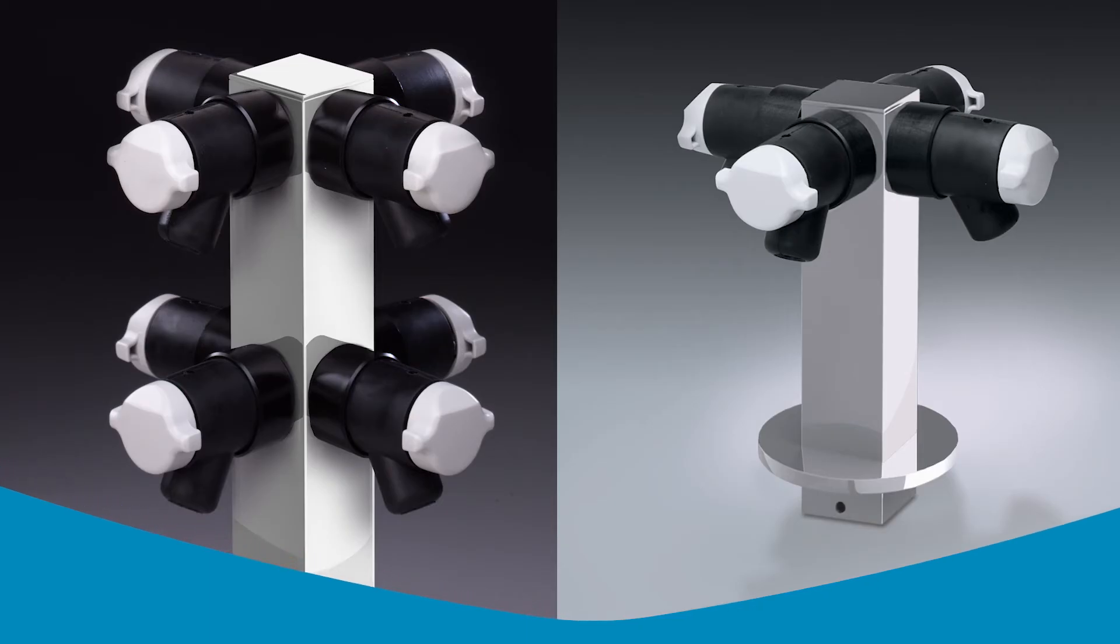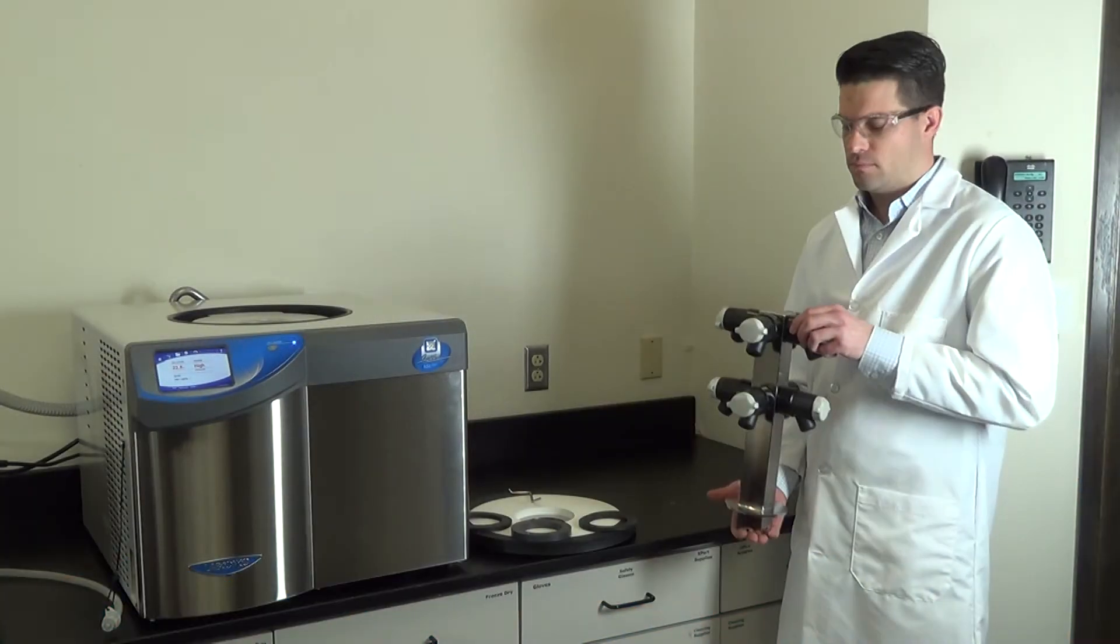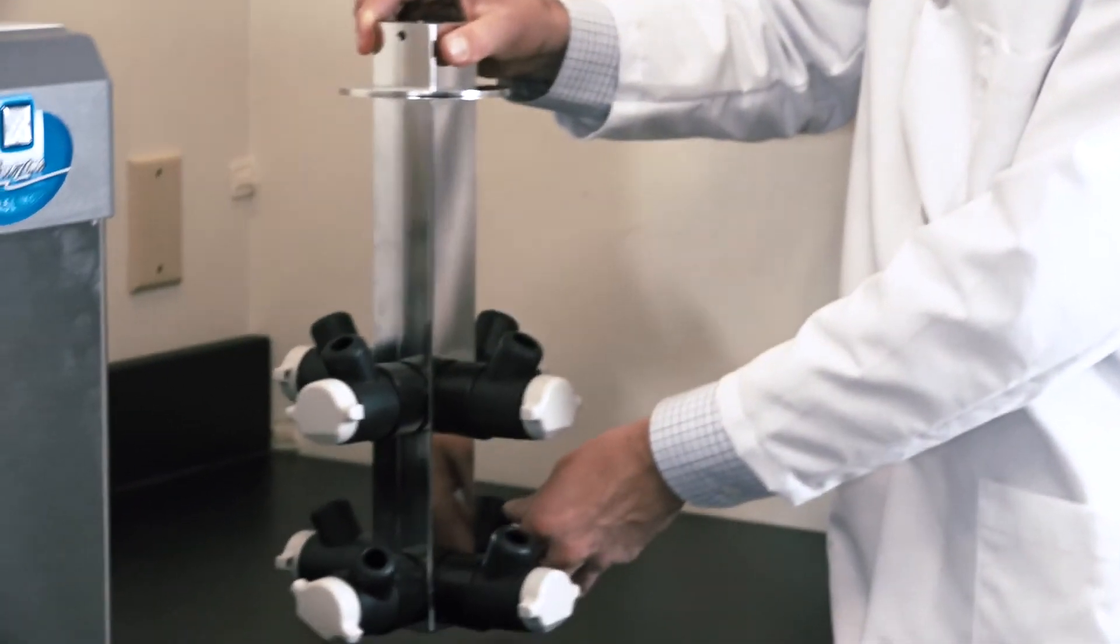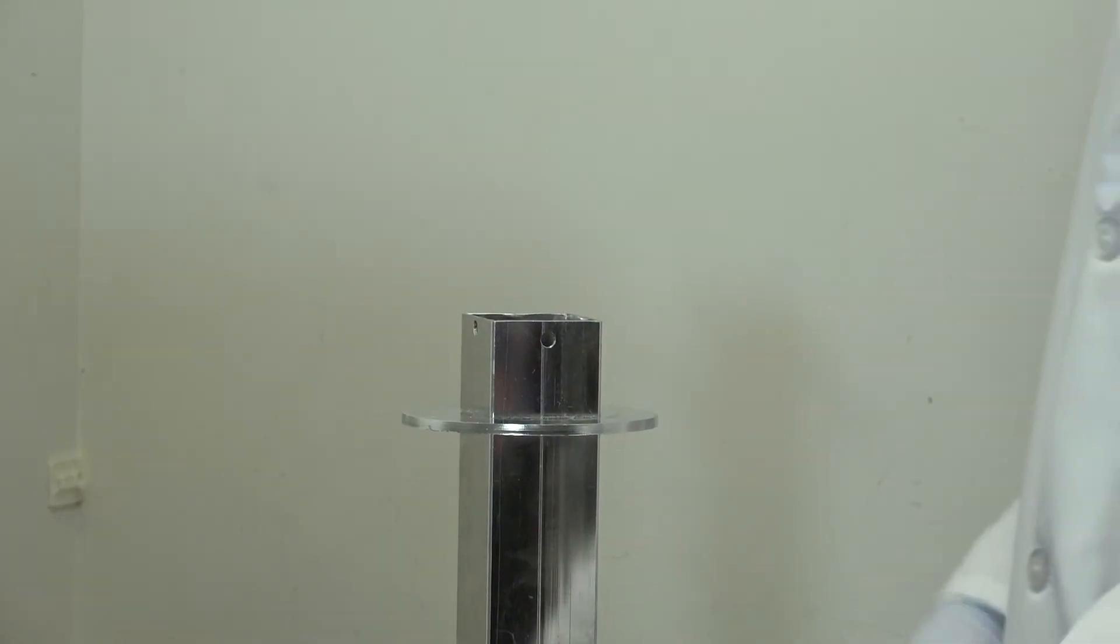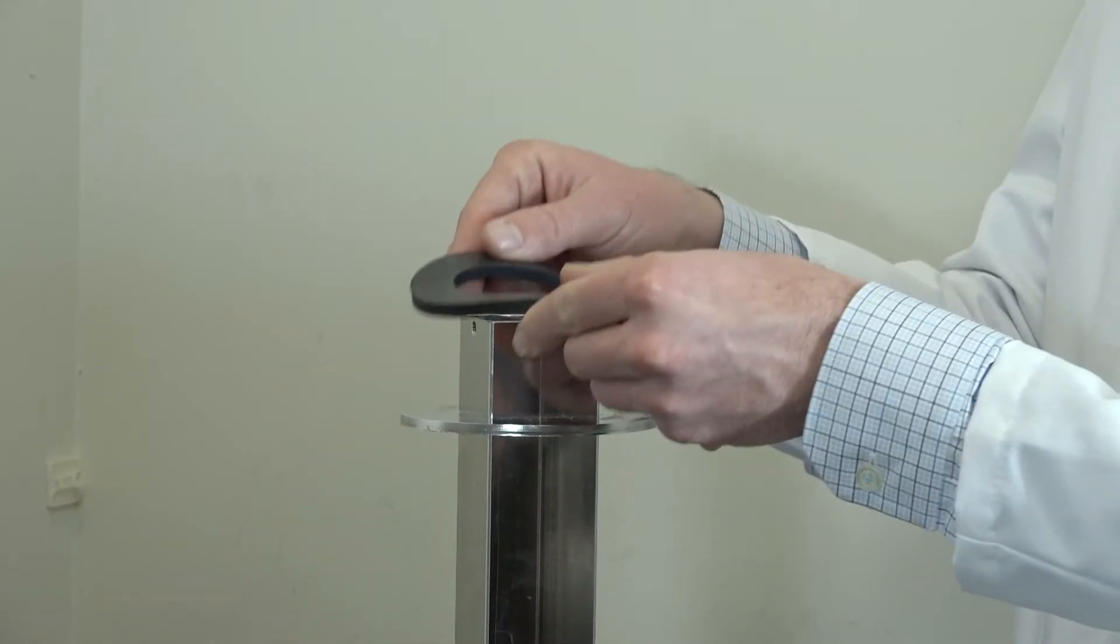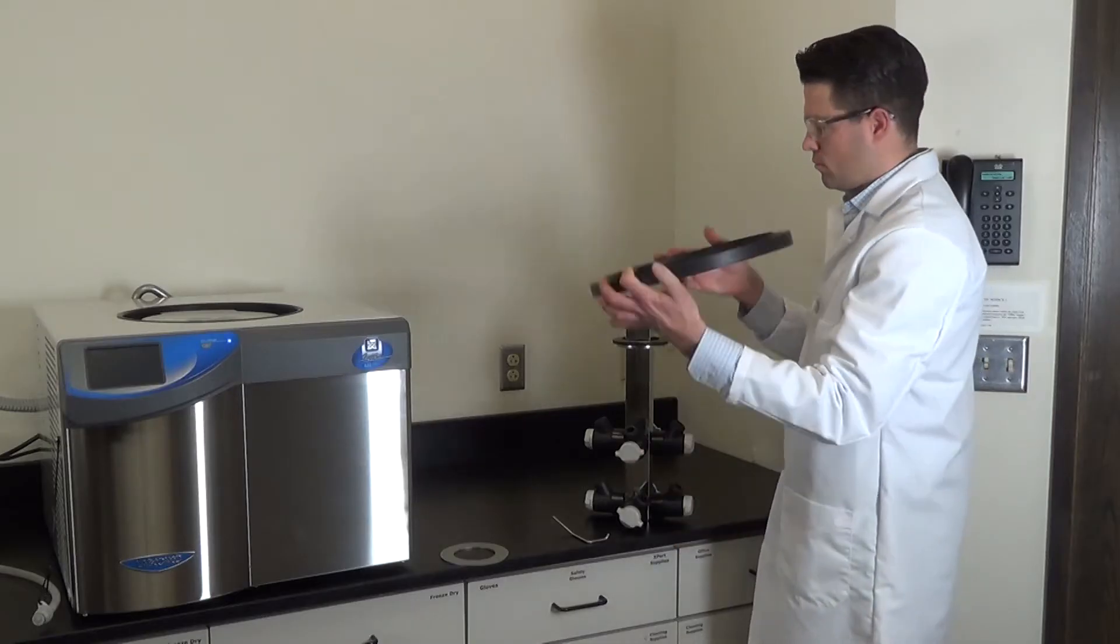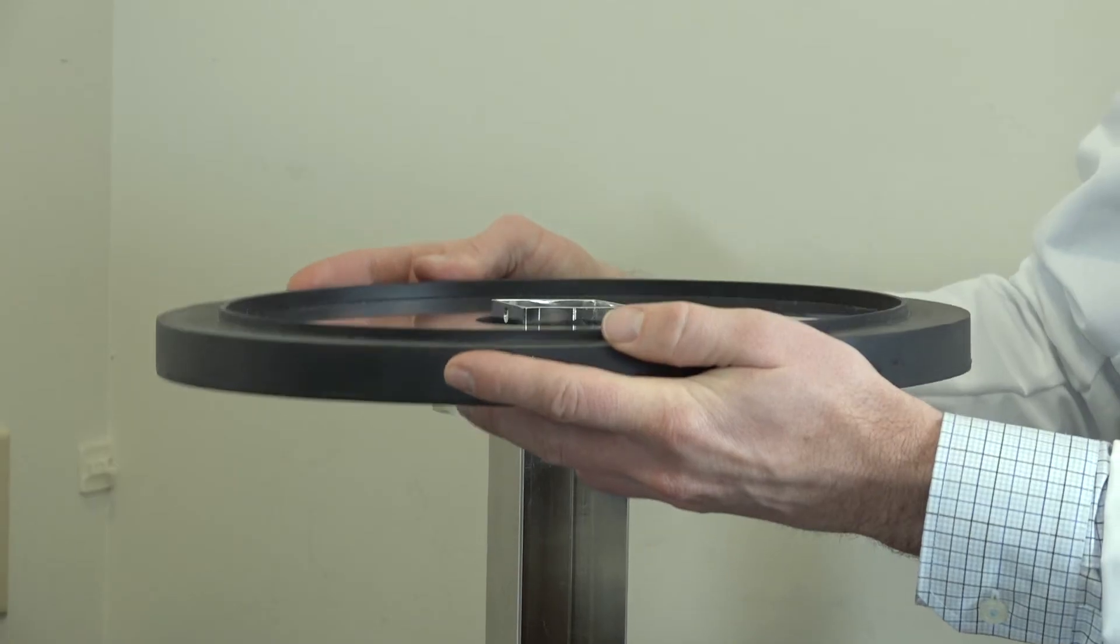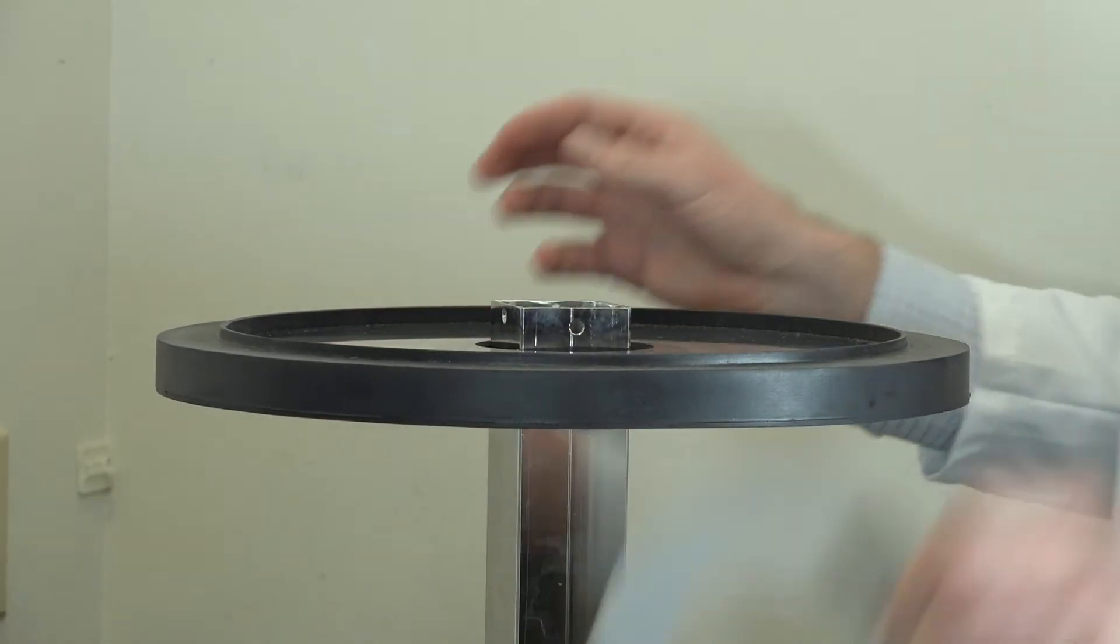Here's how to install a 4 or 8 port manifold. Set the manifold upside down and stack components onto the manifold in this order: first the gasket, then the acrylic lid with gasket centering ring facing upward, now the stainless steel ring.